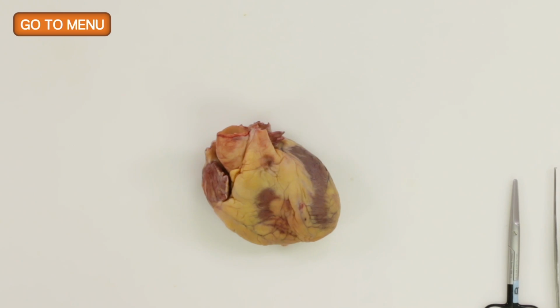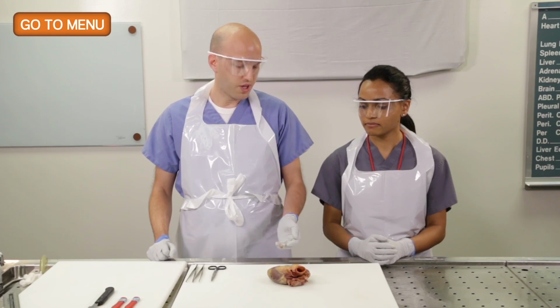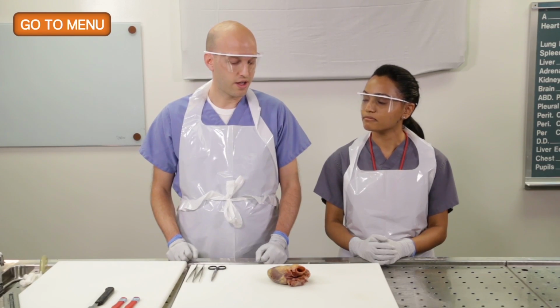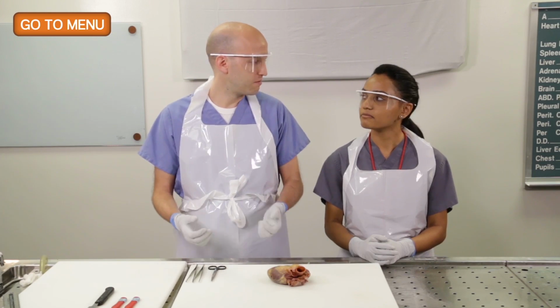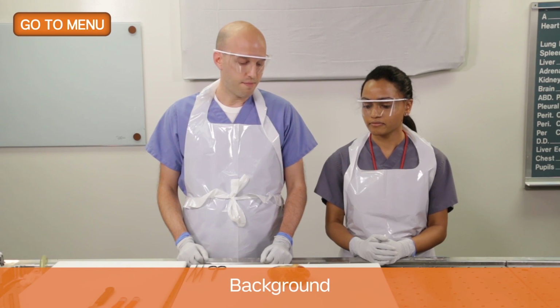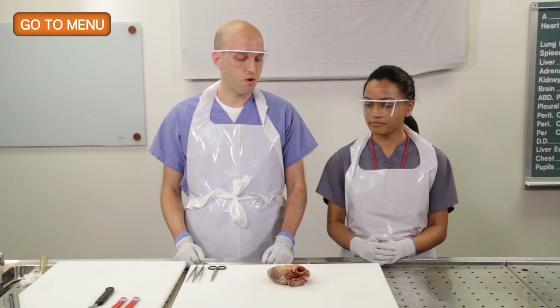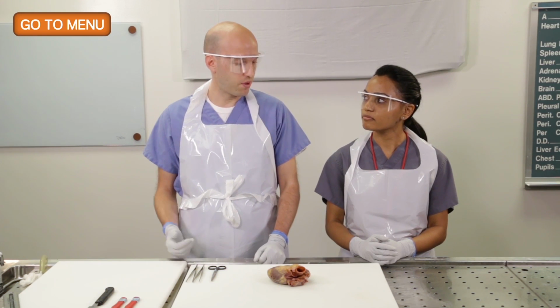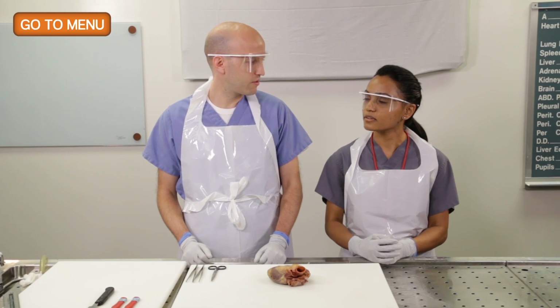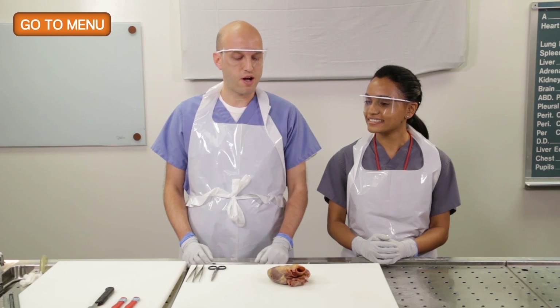dissection. So here we have a heart, and this is a little bit different, obviously, than surgical pathology. Number one, we don't get hearts on surgical pathology in general. And we also don't get things in autopsy like they're delivered in surgical pathology, with a specimen by itself. So we've already done some things prior to filming this, and that would be removing the organs. So we get the whole body, we remove the organs in an en bloc format. Do you remember what that's called? The Letulle method? The Letulle method, yeah. And so that's been done prior to this.